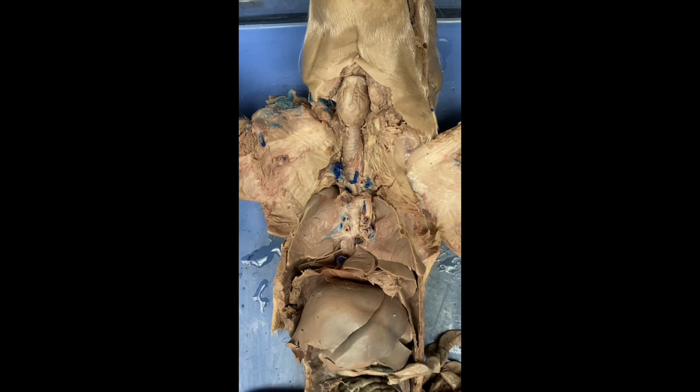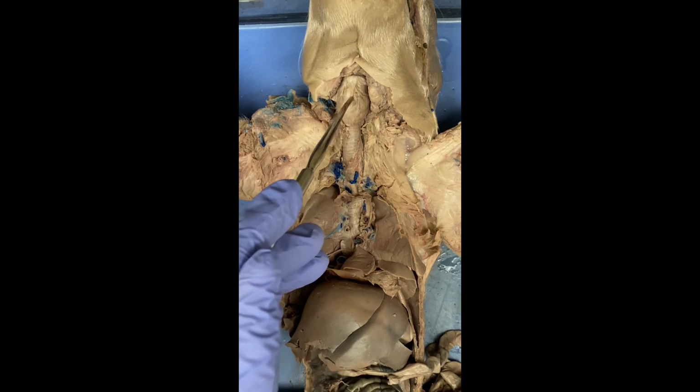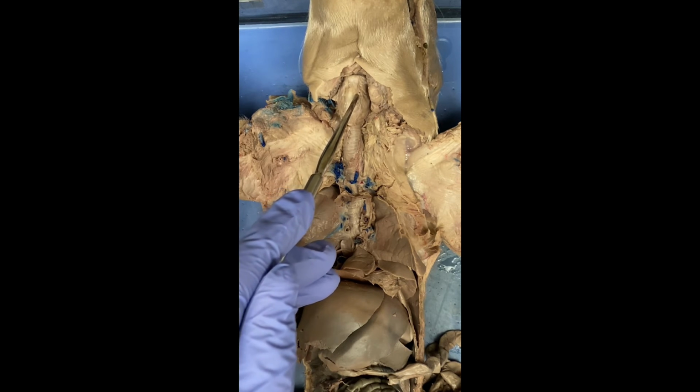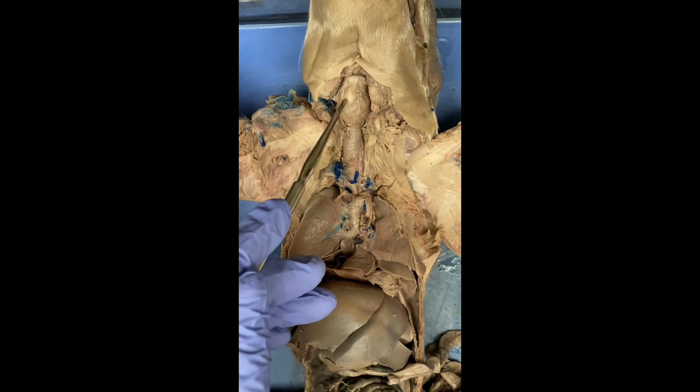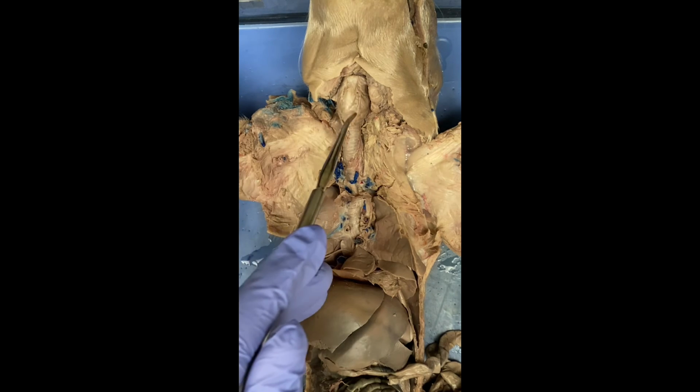It's a lot easier. The larynx is also known as the voice box, and that's going to be right here. And the voice box contains the vocal cords, so it allows for communication. So that's how the pigs can squeal and make oinks and that kind of thing.